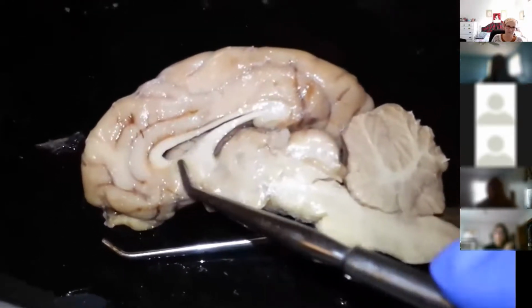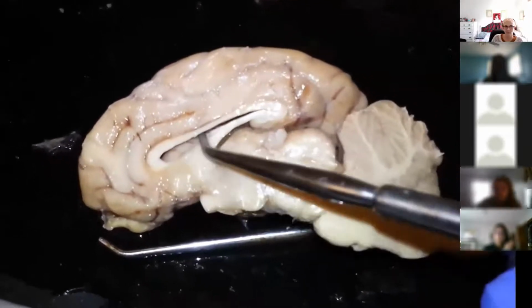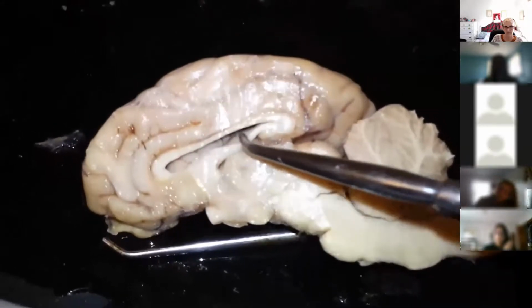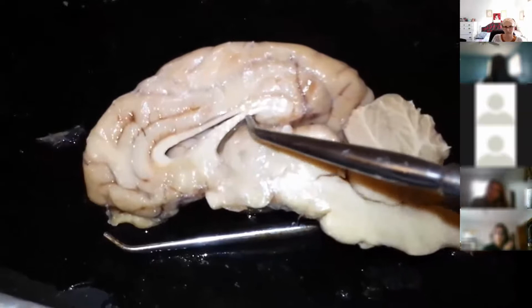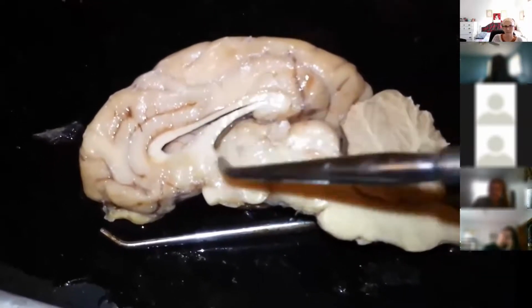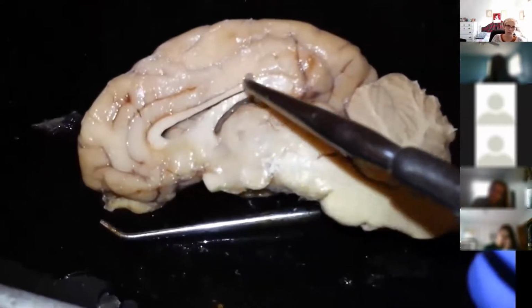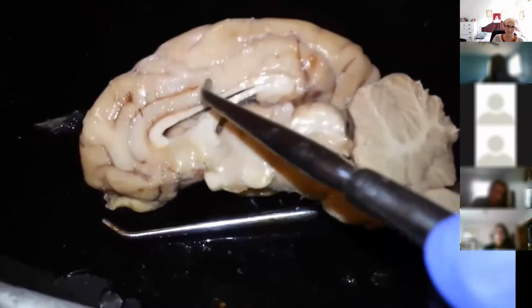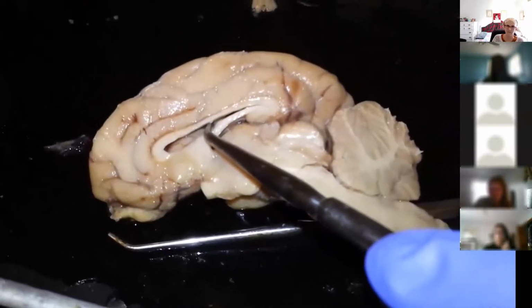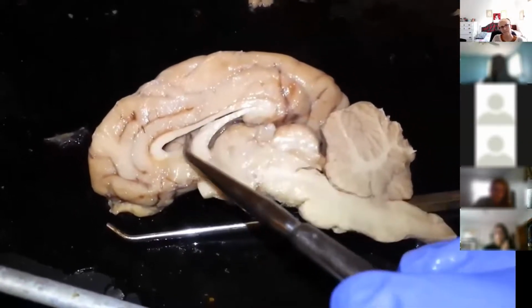We tore that away so that you could see the space in the ventricle inside. Now this part that I'm pulling down so that you can see the space, this tissue right here is the fornix, or what would be the floor of the room, so floor, fornix. Above this white tissue here, what would be the ceiling of the room that I'm pushing on, that is the corpus callosum, and that would be the ceiling of the room. So C, corpus callosum, C, ceiling.